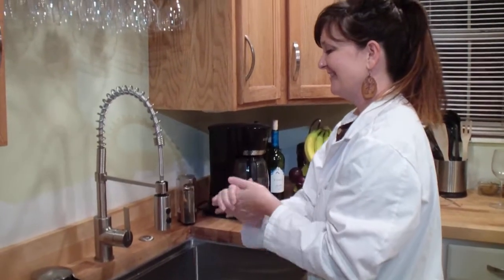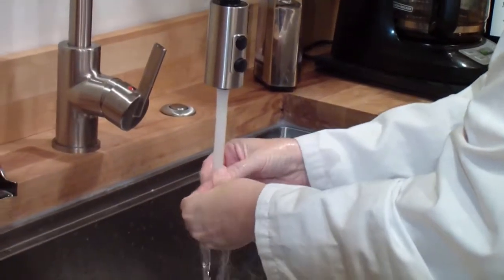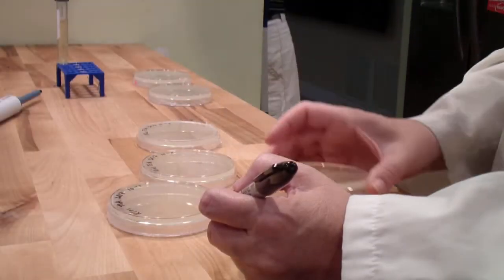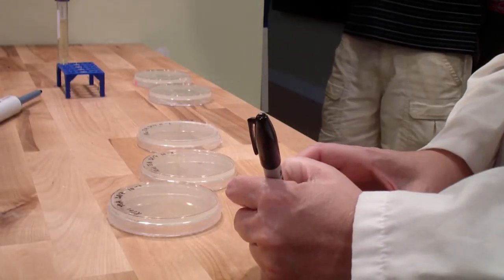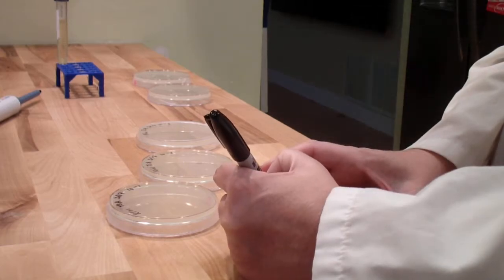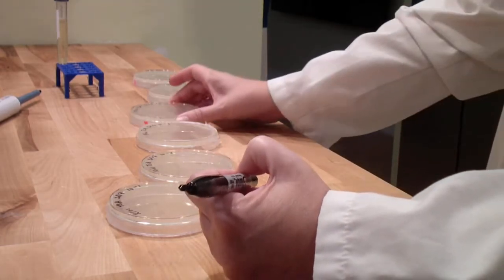First, you will wash your hands, disinfect your work area, label the TSA plates with the date, your initials, and the name of the medium.